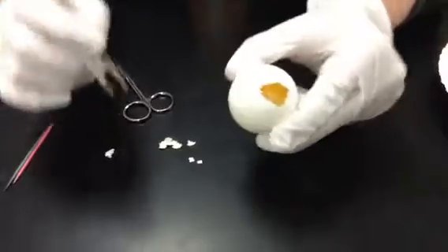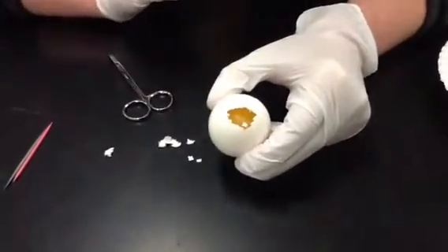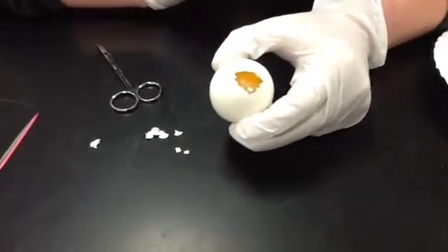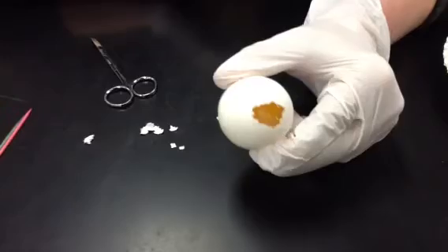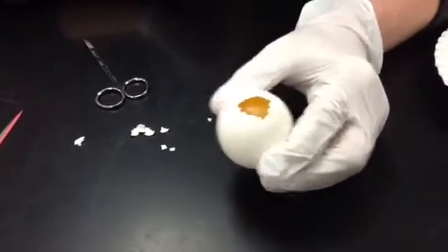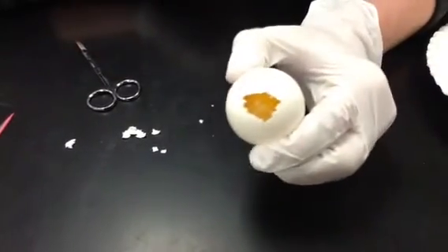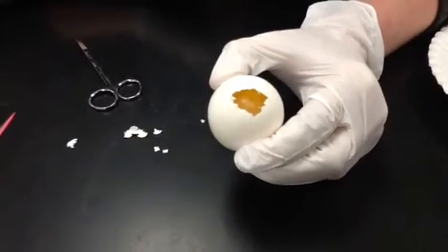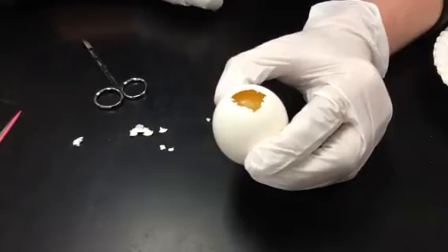And so now you can see, I want you right now for your first question, and the next question underneath here, it says, what is the opening at the fat end of the egg called? So right here, I just opened it up and exposed this. So go ahead with your partner and discuss what part of the egg is exposed at this point, and then write that down for your next question.